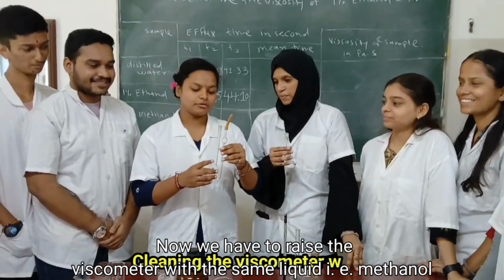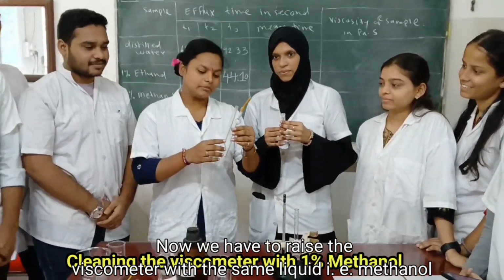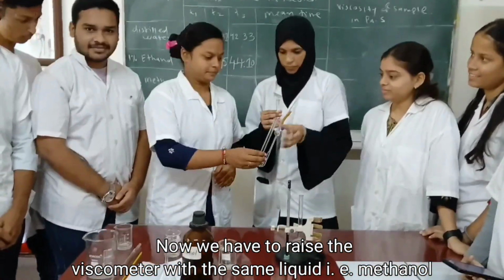Now we have to rinse the viscometer with the same liquid, that is methanol.